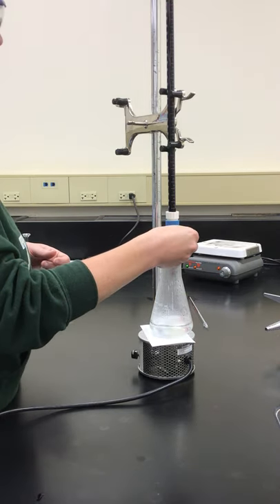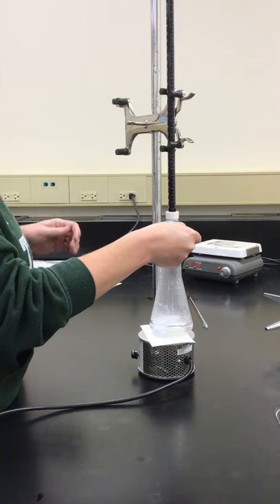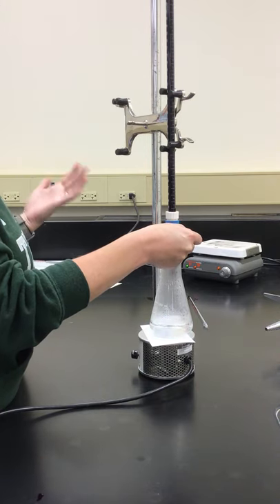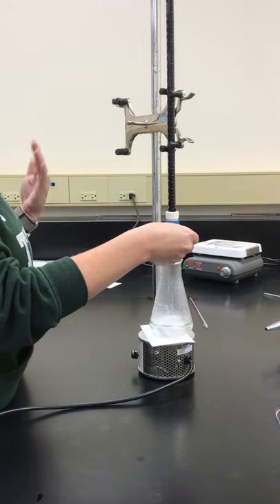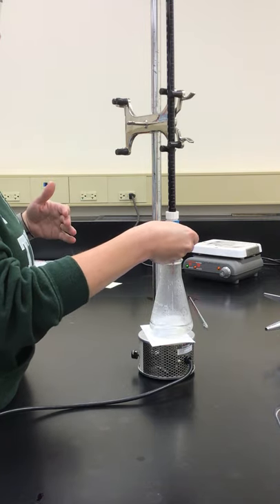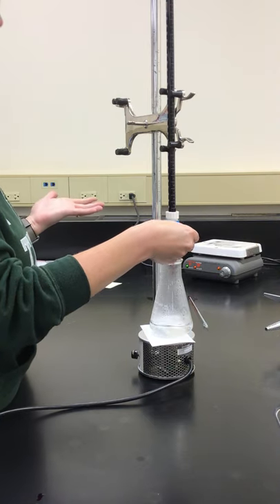We're looking for that change in oxidation number of our manganese to plus two, which is that light pink color.